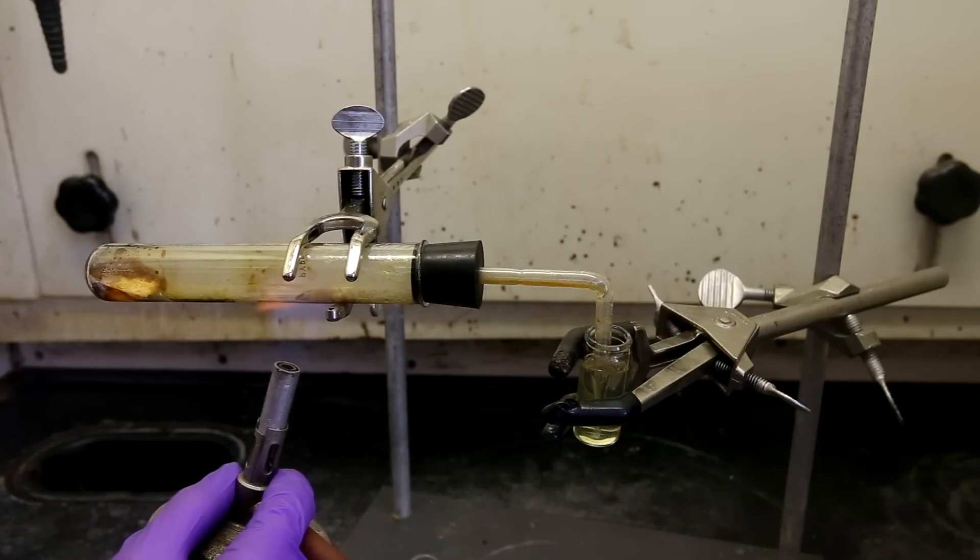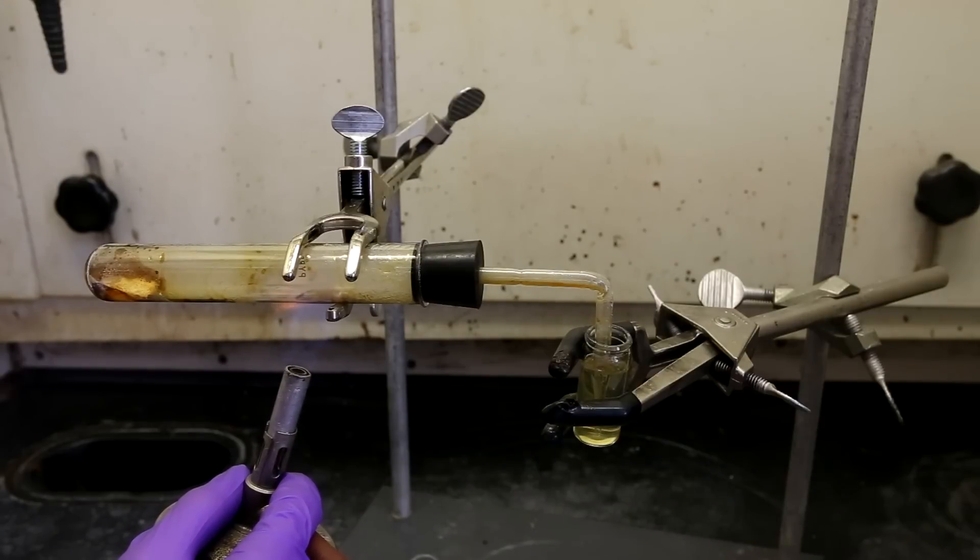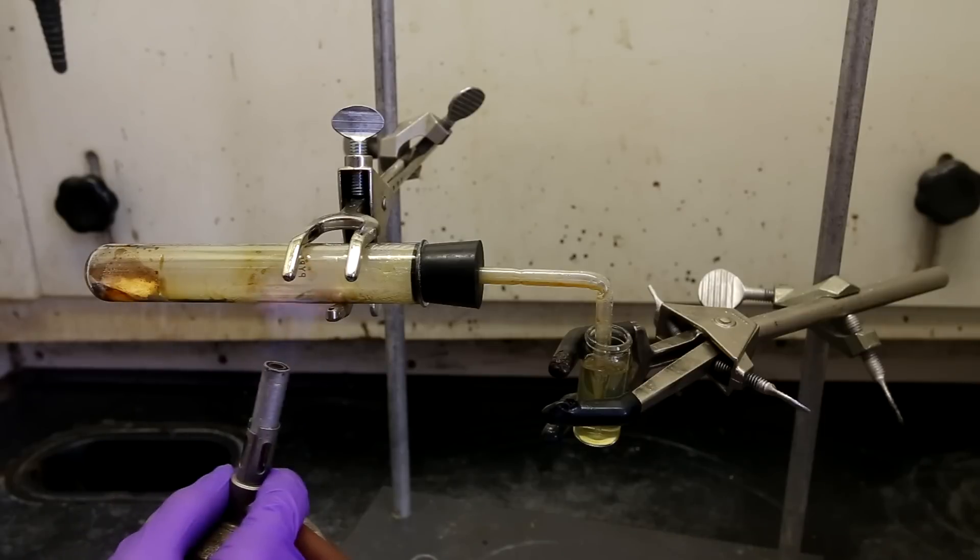Occasionally you can see some oily cadaverine sludge moving through the bent Pasteur pipette tube into the dram vial.